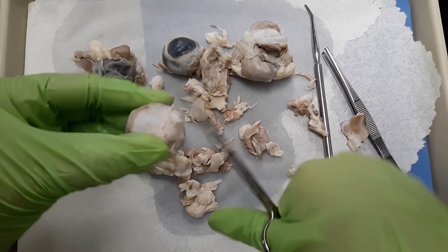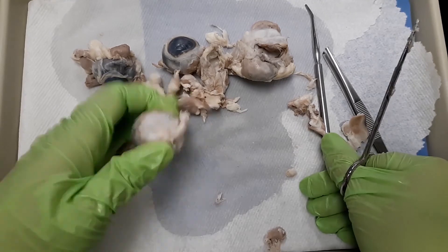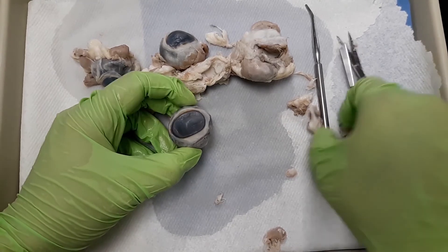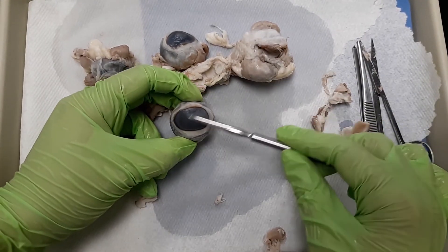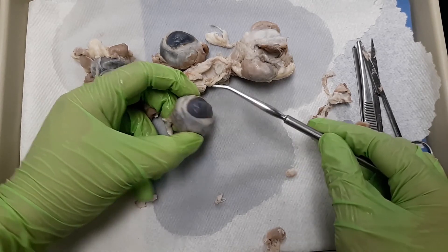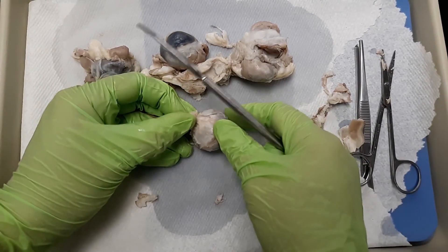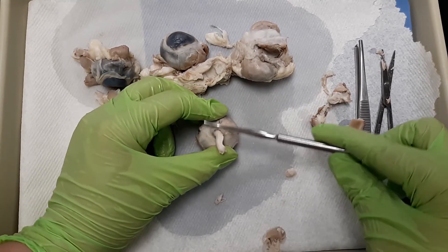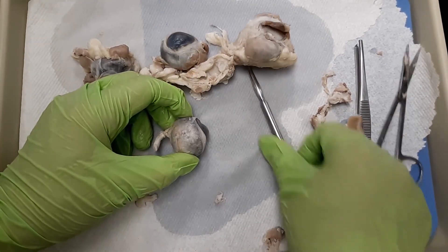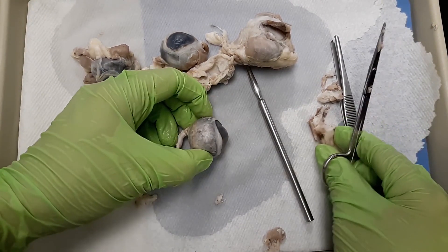It's looking better — how particular you are here really works for your benefit. Nice beautiful sclera. Let's examine our handiwork: I have the anterior view with the cornea, which covers the iris and resulting pupil. We have the sclera — this beautiful white part — and we have the optic nerve on the posterior side. Now that we have the cornea in the front and the optic nerve in the back, we're going to be cutting through. Some people use a scalpel, some people use scissors — we're going to go ahead and use this.